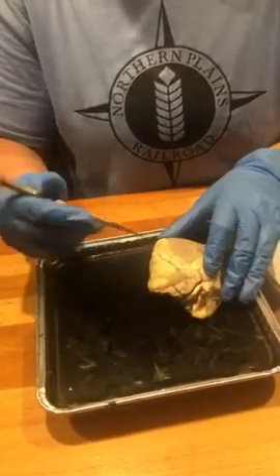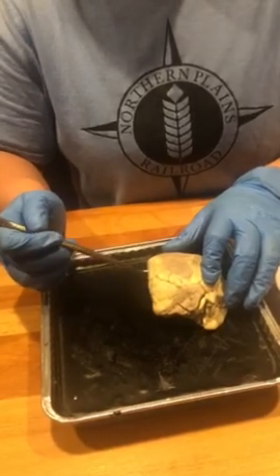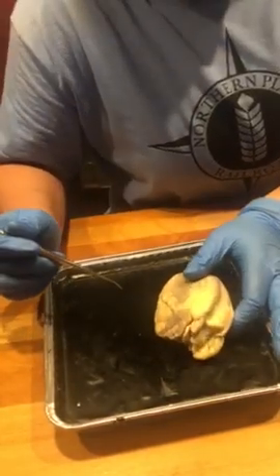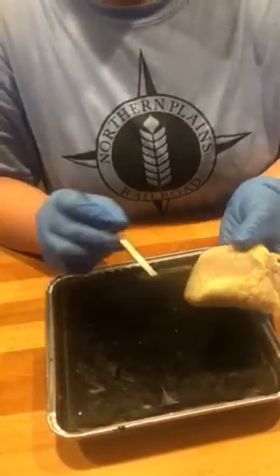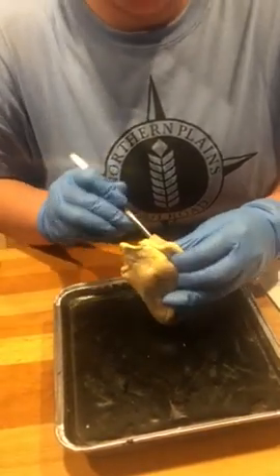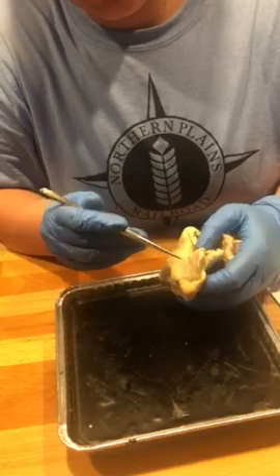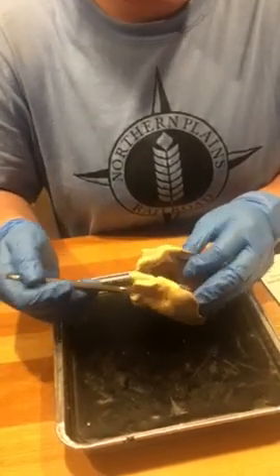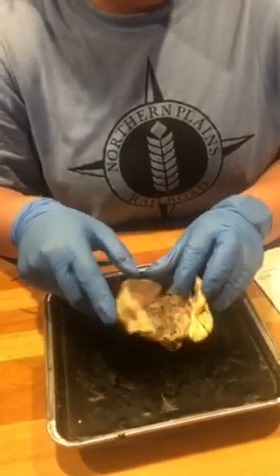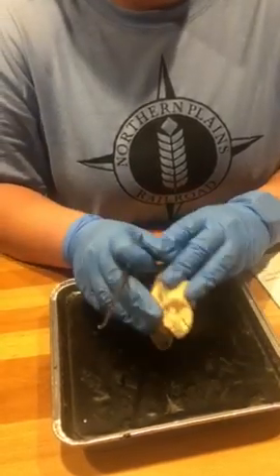And then we have the coronary artery right here, a large artery that supplies blood to the actual heart muscle. And then we have the inferior and superior vena cava, both. Our inferior would be down here, but we can really just see our superior, which is right there, and then another opening right back here. These are our superior and inferior vena cava, both veins that bring blood to the right atrium from the upper and the lower parts of the body.